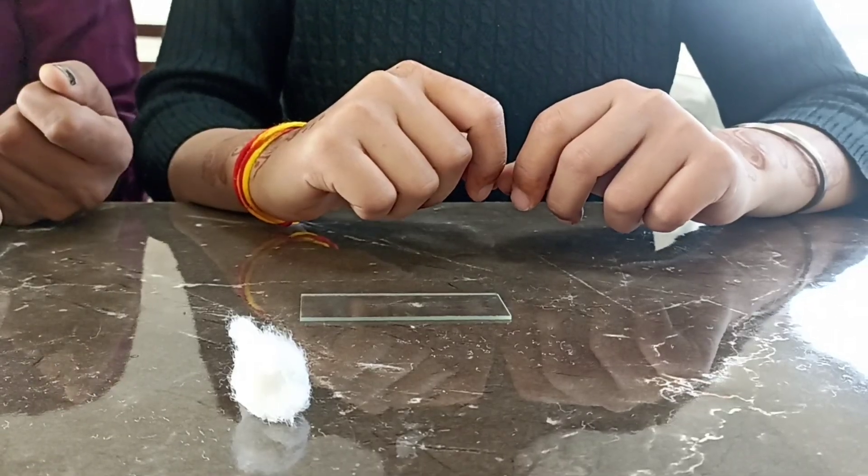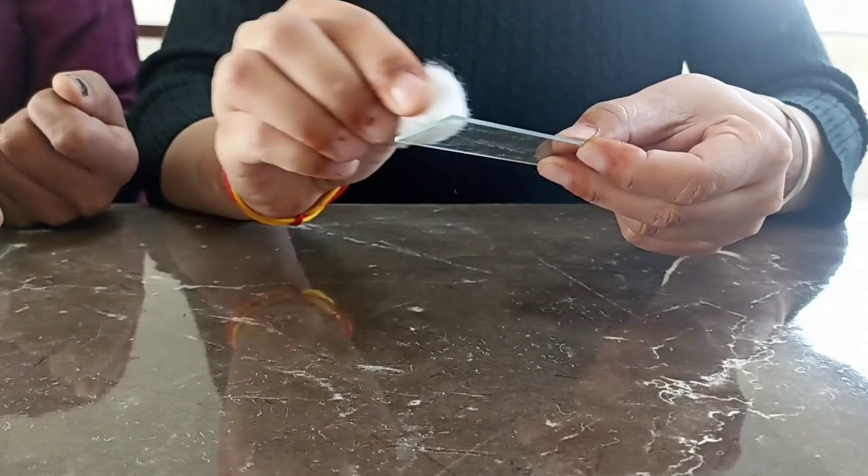Now let's move on to the procedure. First, we need to clean the slide with the alcohol.